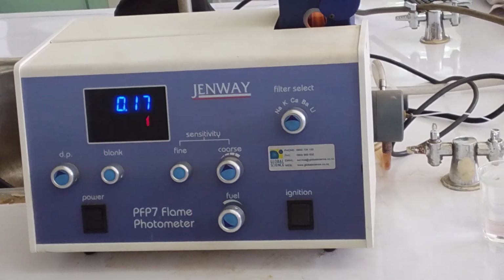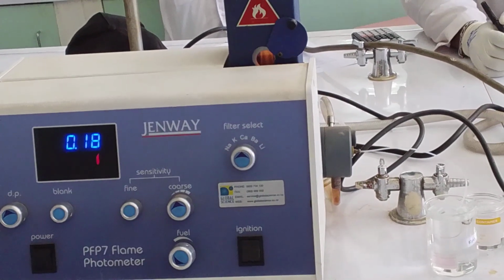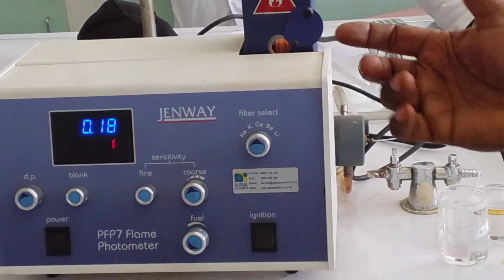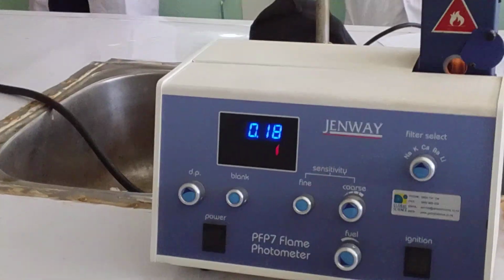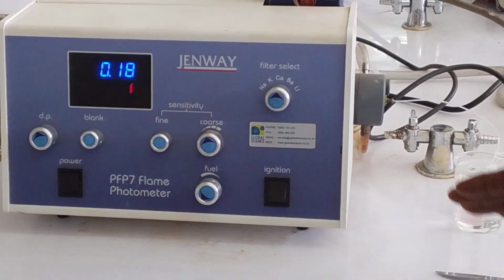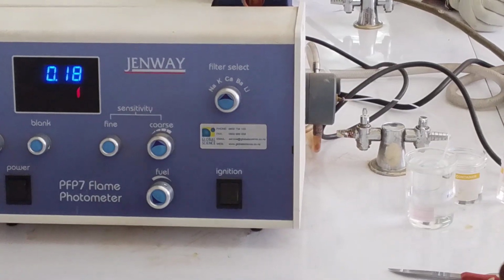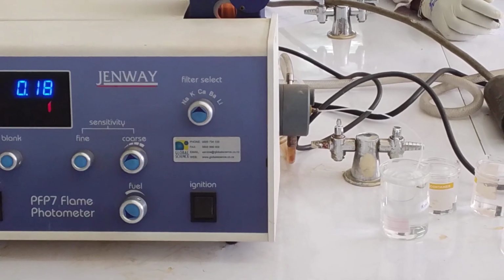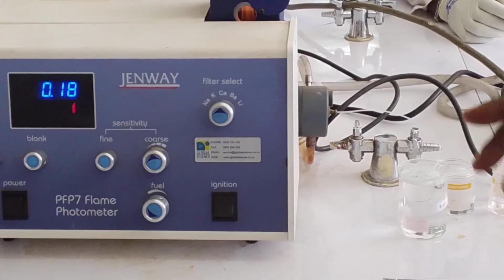If you go up to Mount William and you collect a sample, you have no water there. What would you do if you have a can of Coke there? You use your can of Coke. You make up your sample. Then you bring it to the lab. You use the can of Coke as a blank. And the reading you get, anything from the can of Coke will not be counted. It's only the sample. So blank is never the water only. It's any medium that you use to make up the sample.